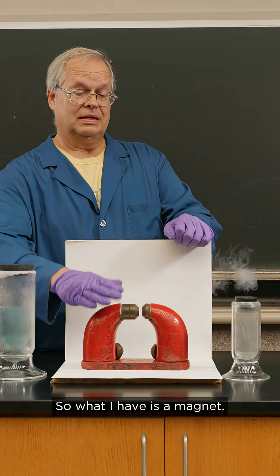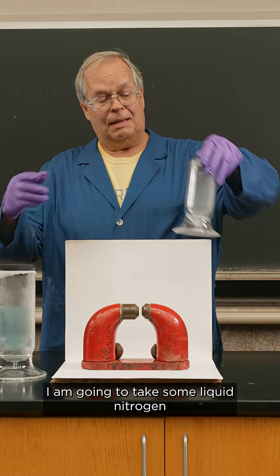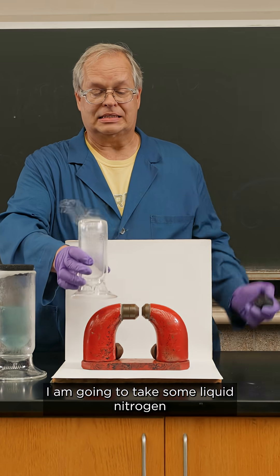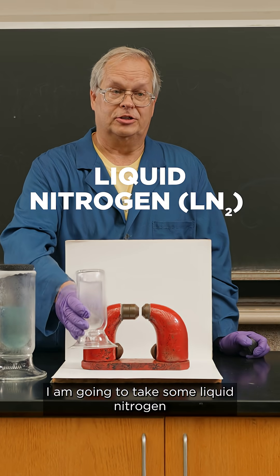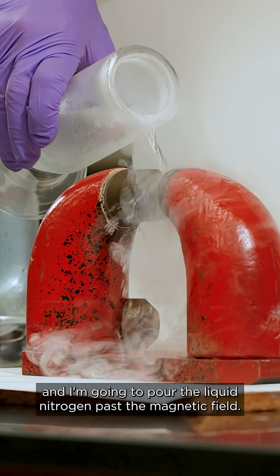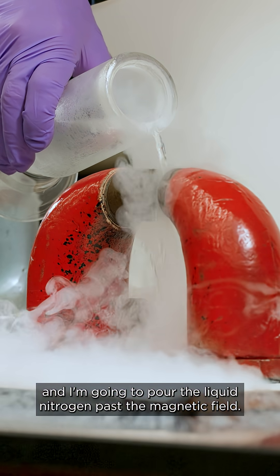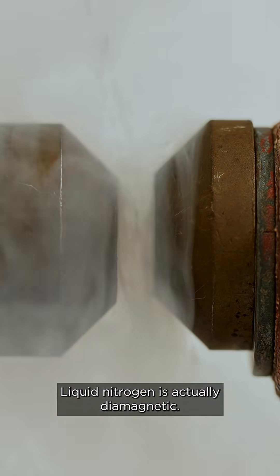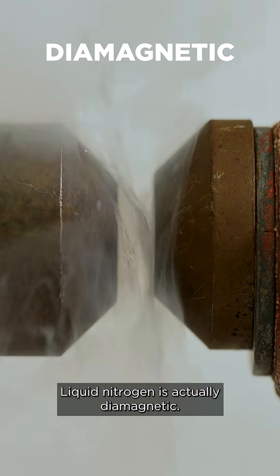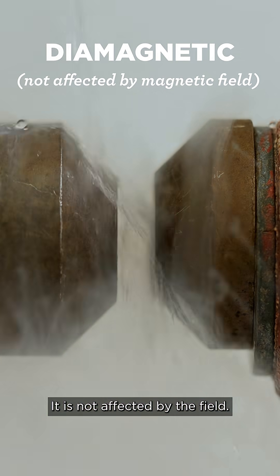So what I have is a magnet. I am going to take some liquid nitrogen and I'm going to pour the liquid nitrogen past the magnetic field. Liquid nitrogen is actually diamagnetic — it is not affected by the field.